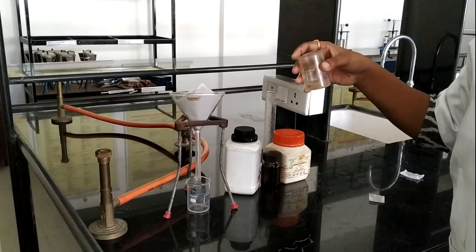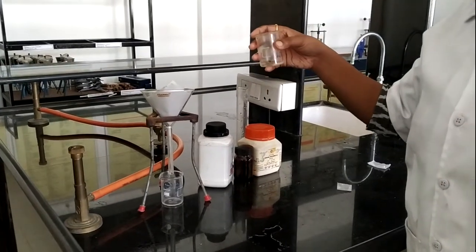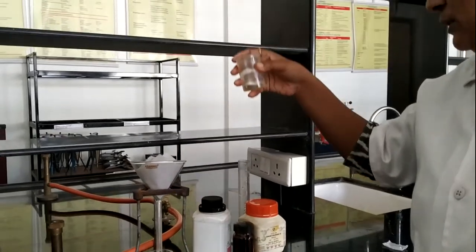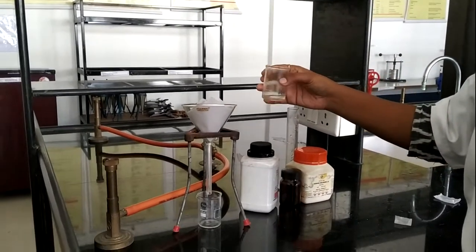After dissolving all these three ingredients, our solution is a little bit turbid. In this solution, little bit particles are seen, so let's proceed for filtration.